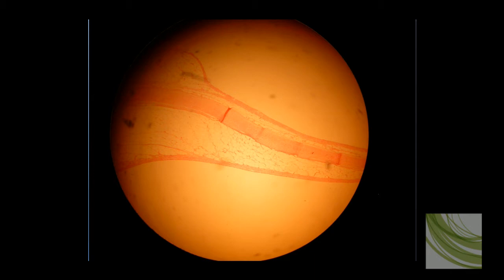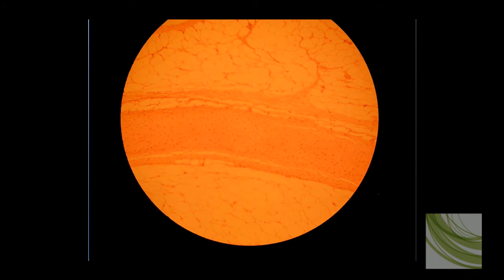Here is the same tissue slide, but we have increased the magnification to the 10X objective, and we can see our band of hyaline cartilage. Now we can start to see some chondrocytes in little lacuna. We can kind of see this smooth matrix between the lacuna. We still can't see a lot of detail, but on either side we can see this adipose tissue, so we want to concentrate in this region right here.